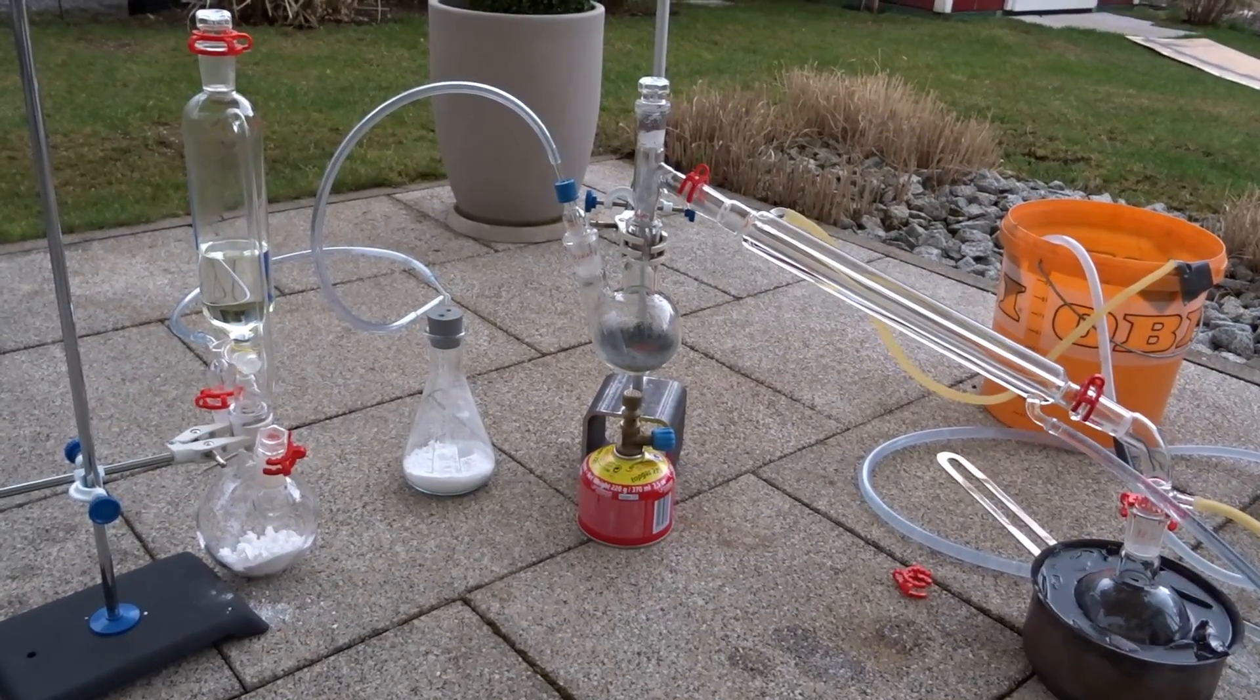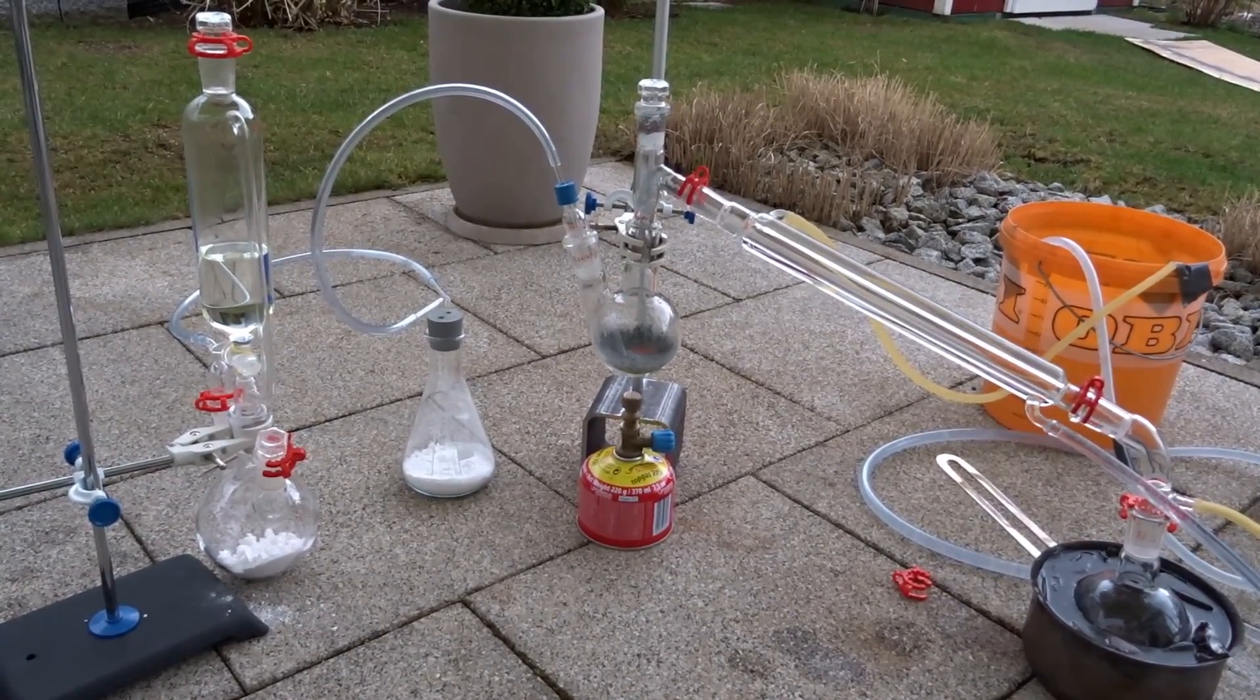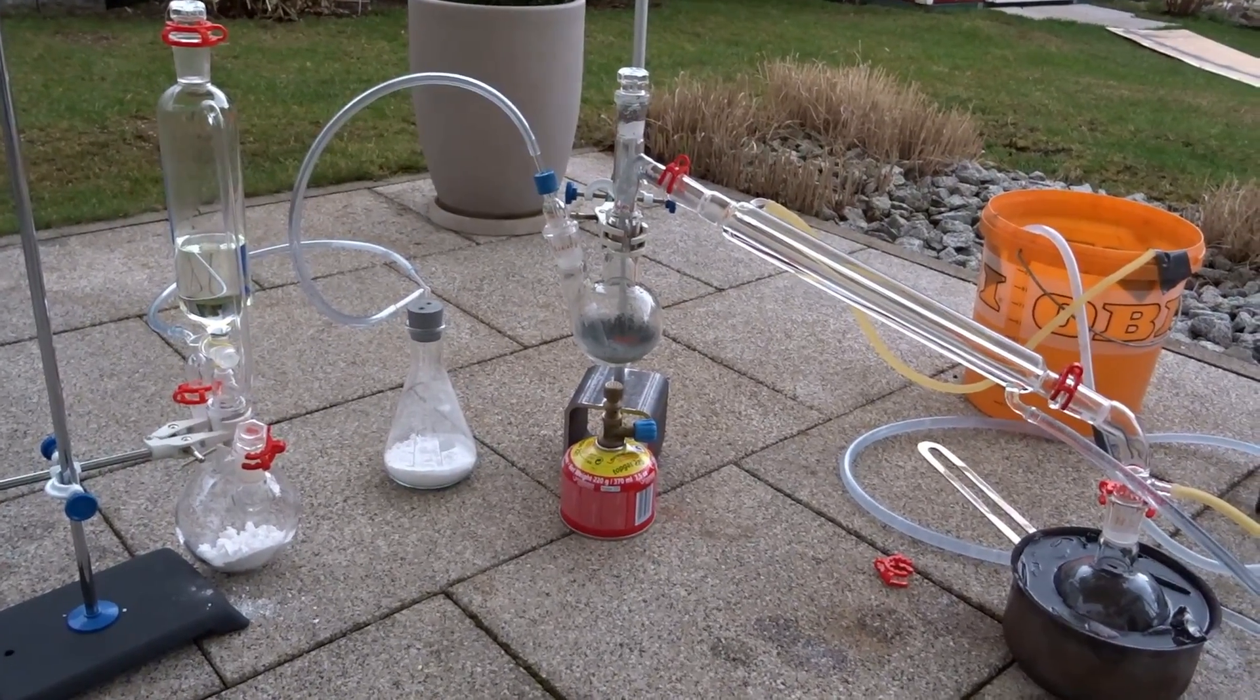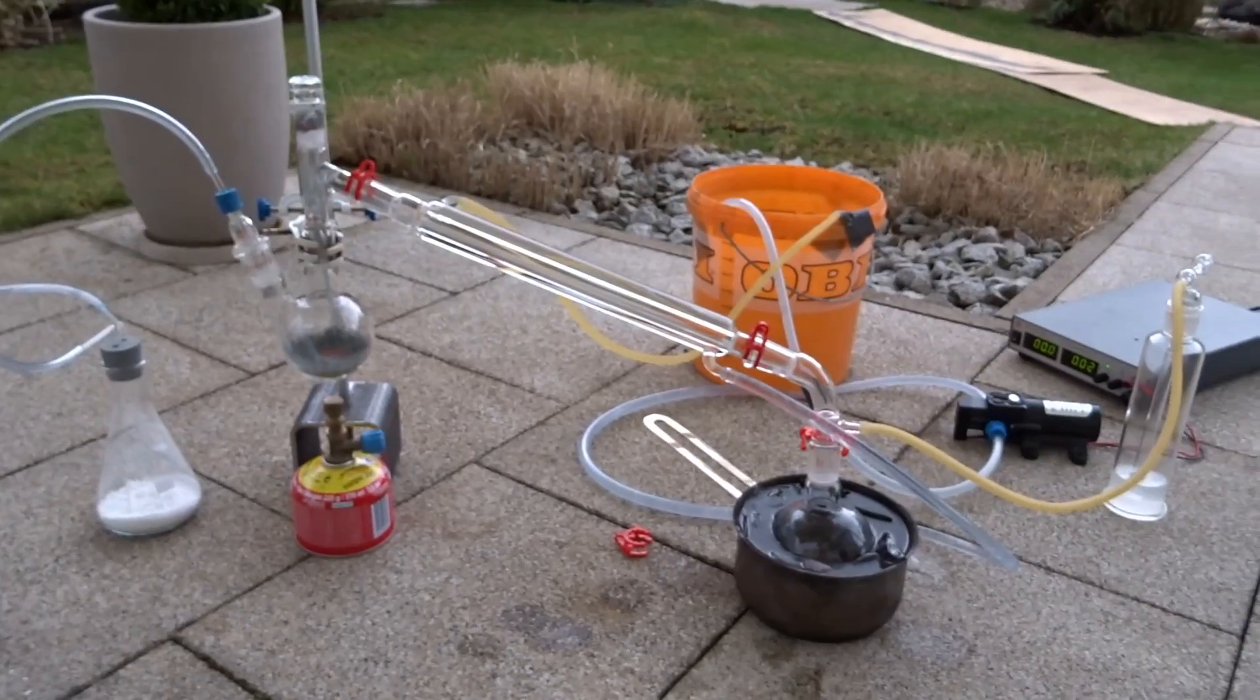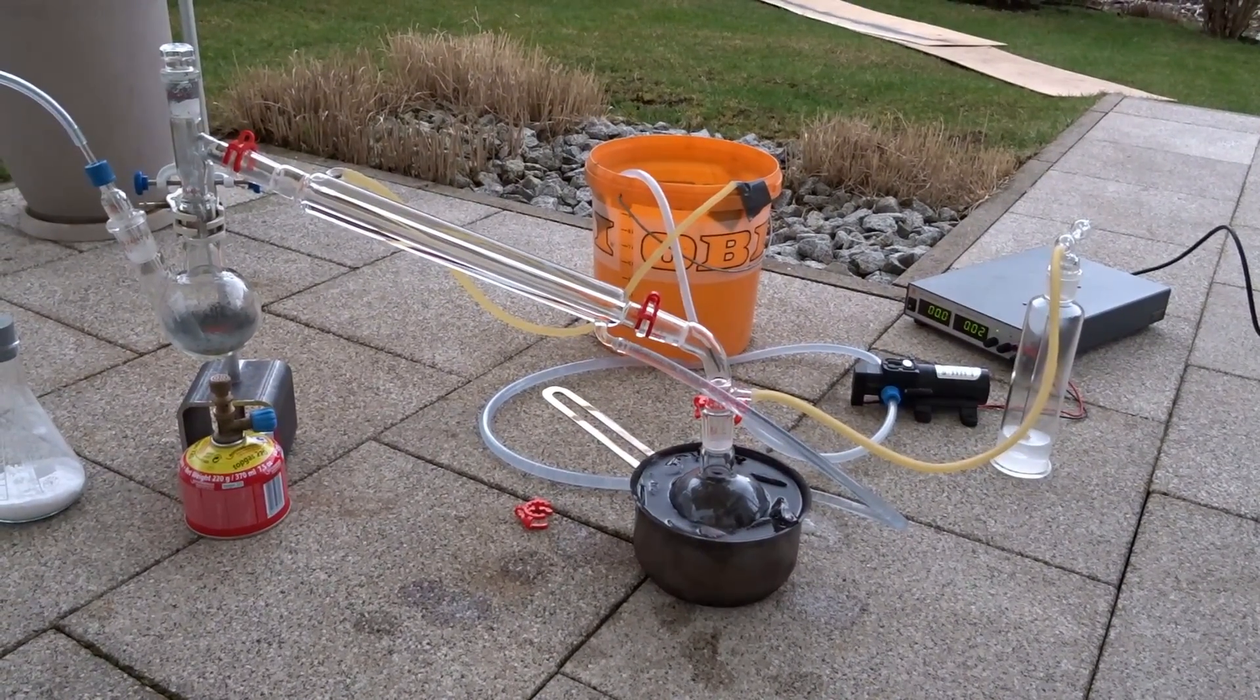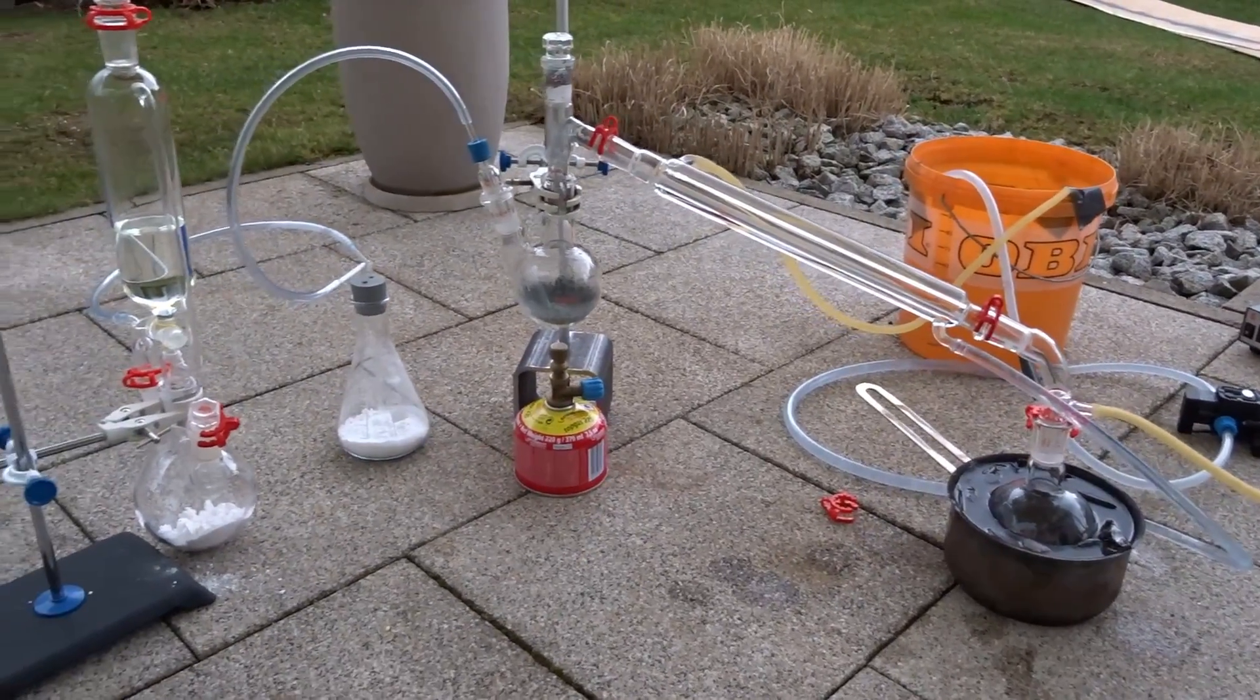So here I tried to make silicon tetrachloride, which I planned to use to make TEOS, but it didn't actually work out. But still I want to show you the setup, because it's one of the most impressive setups of chemistry I've ever had.